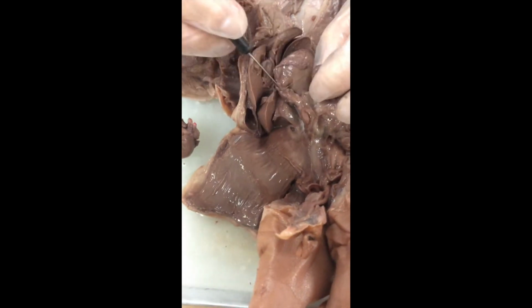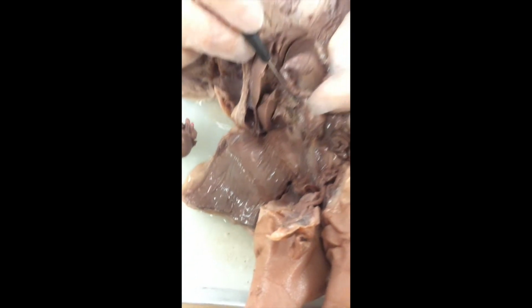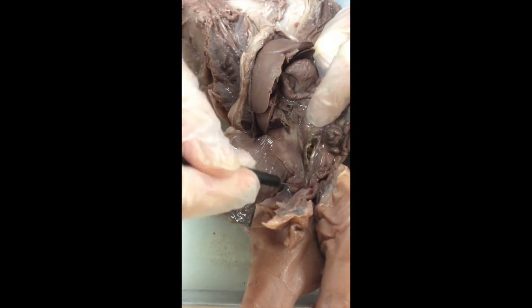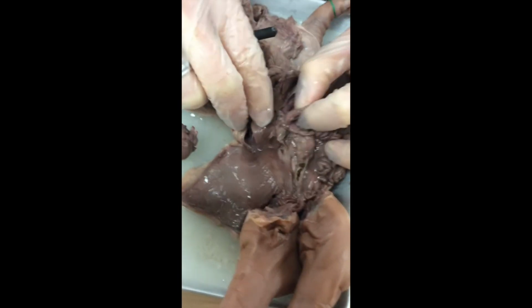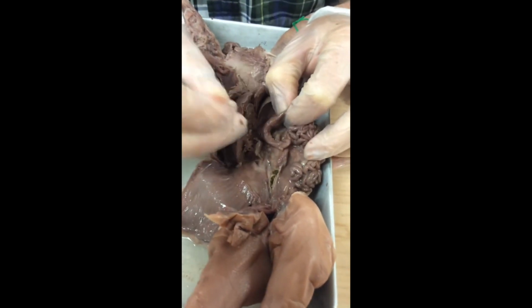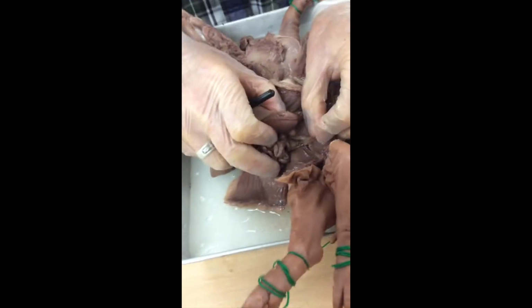And we see all kinds of intestine here. And by the way, when you get this far, you can take, oops, didn't mean to lacerate that. I did. You can take the liver out. You would discover that there are multiple lobes of liver as well, and I want you to count them. We're going to go ahead and take out all of this stuff also. I'm going to try to keep it fairly intact.